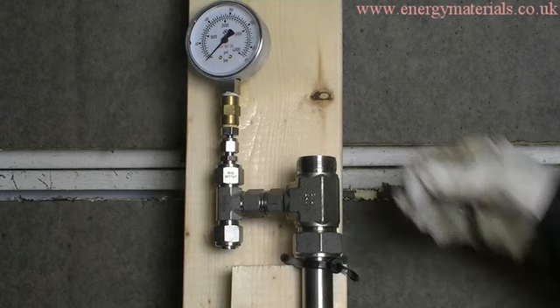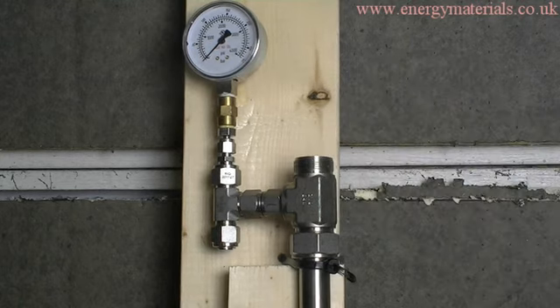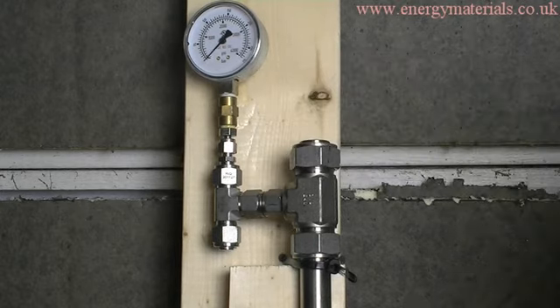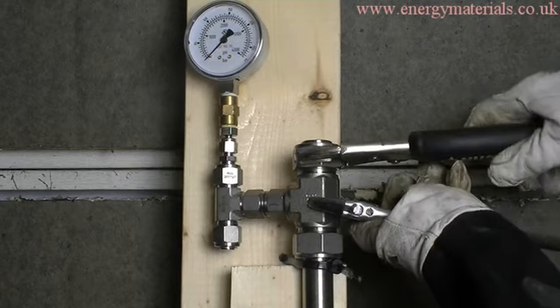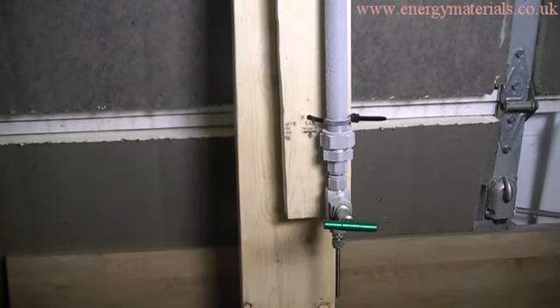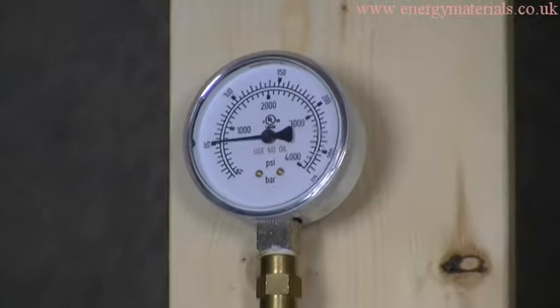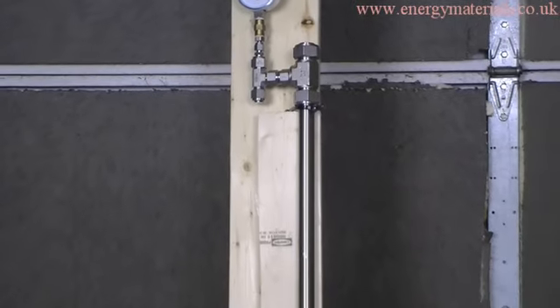If we use a stronger pressure vessel, we can form this equilibrium between liquid and gaseous CO2. Here we are loading up a pressure vessel with some dry ice. Once it is loaded we seal the top, and as the dry ice warms up to room temperature the pressure increases. Once the pressure vessel and carbon dioxide reach thermal equilibrium at room temperature, the equilibrium pressure is around 50 atm, and there will be an equilibrium between liquid CO2 and gaseous CO2.